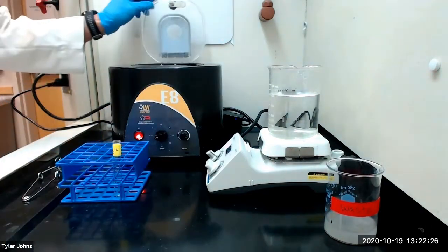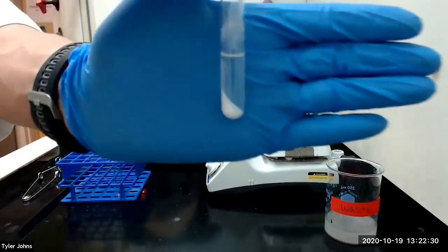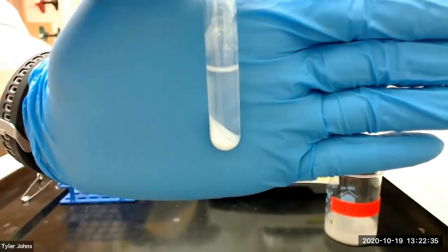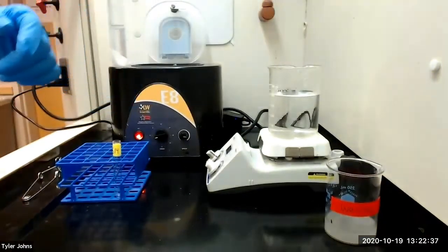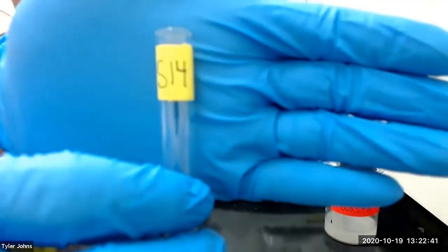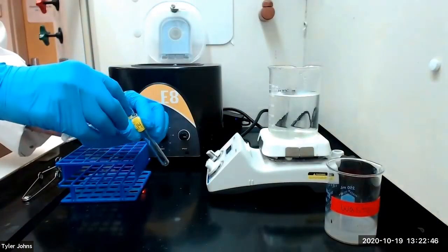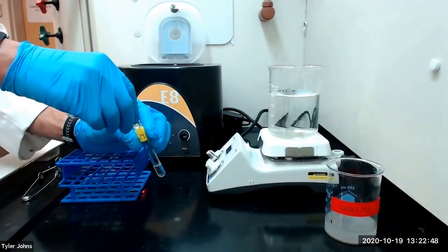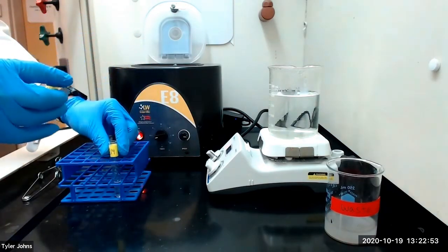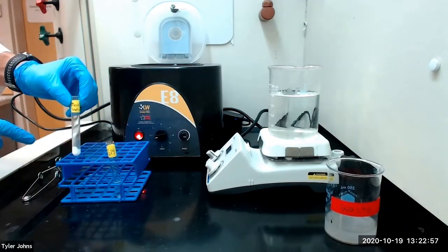This is what our mixture looks like after centrifugation. We will save our solution for the analysis of magnesium ion in a new test tube labeled S14. We will relabel our residue as R14.